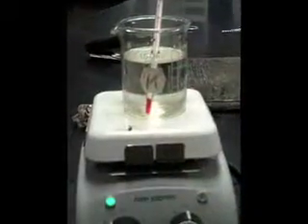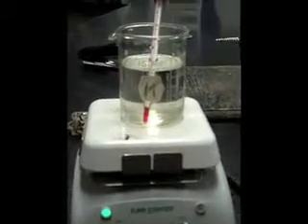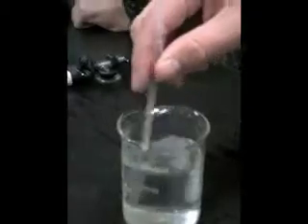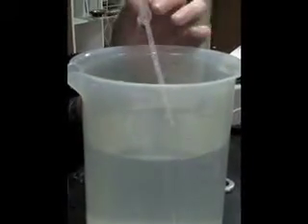We're now heating the water to 45 degrees Celsius. Now we have to swirl the upside down pipette in the hot water for 1 minute. We're now recording the drops at 46.6 degrees Celsius. There are 15 drops drawn in at 46.6 degrees Celsius.